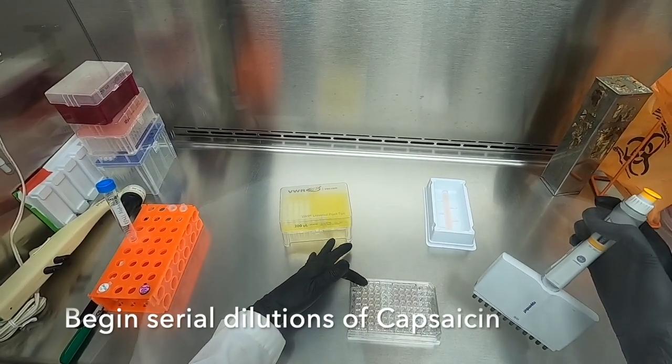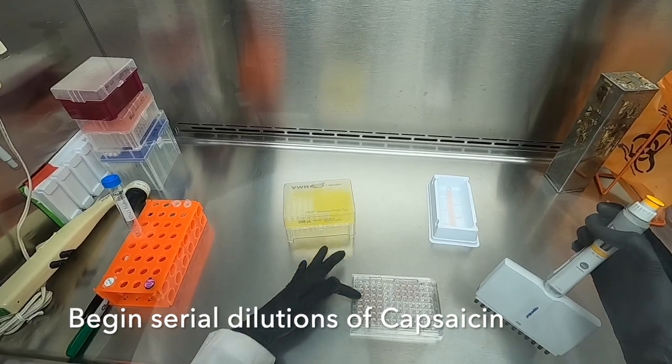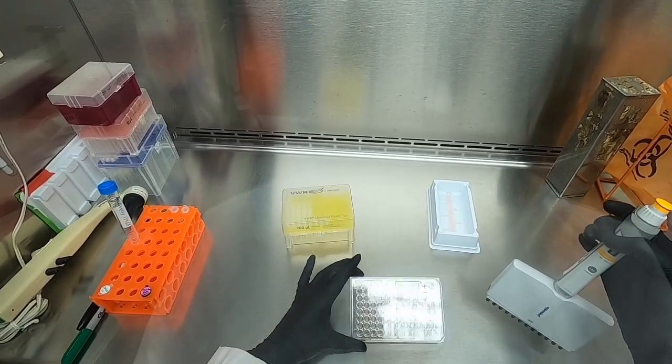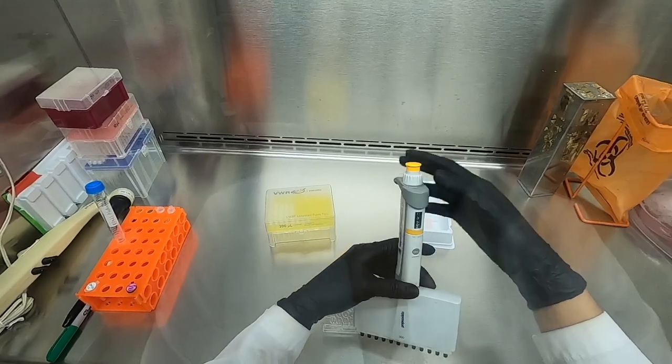We will now begin our serial dilutions. We will begin at the highest concentration and work our way to our lowest concentration.